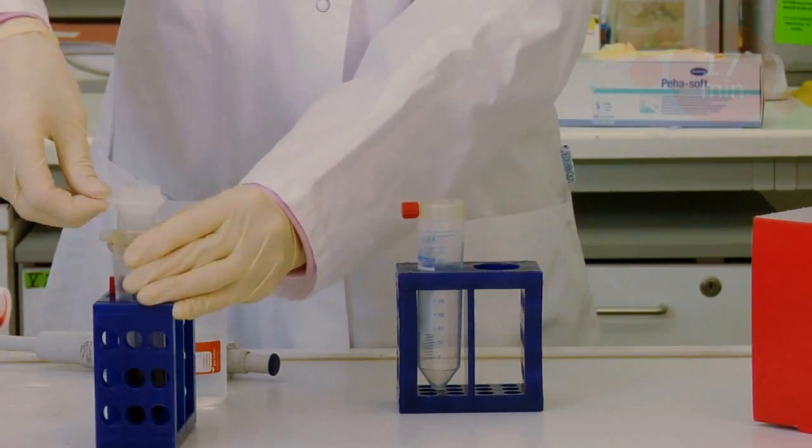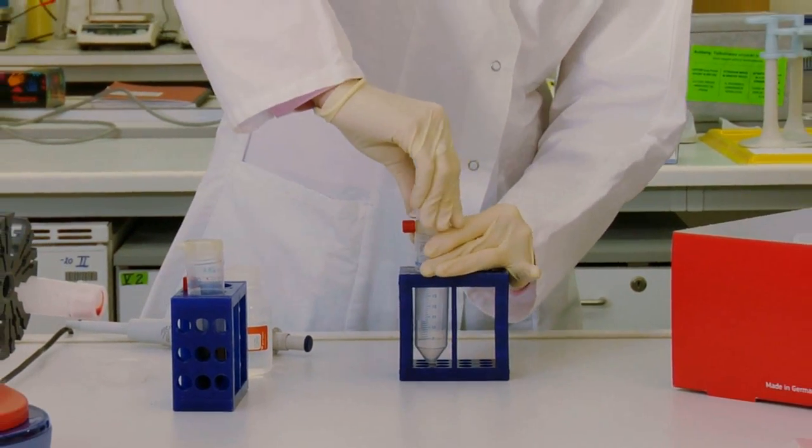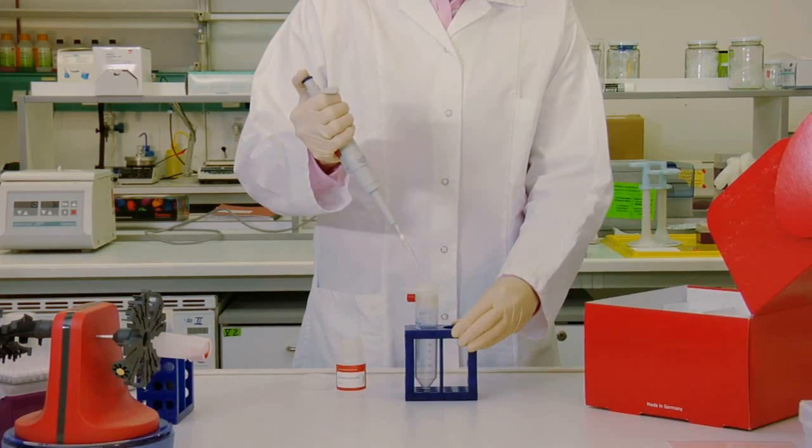A connector ring is therefore pushed onto an empty reaction tube, and then the sieve with the target cells is placed on it. A special detachment buffer is added.